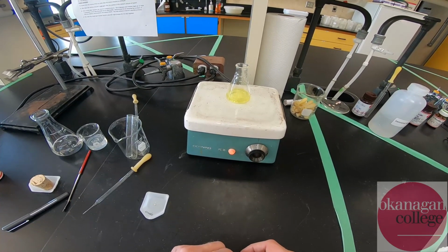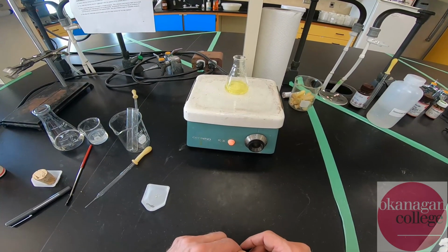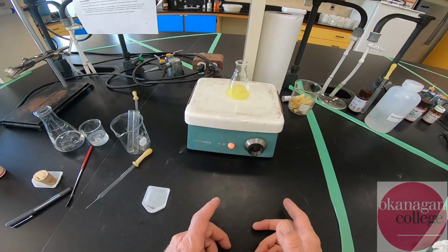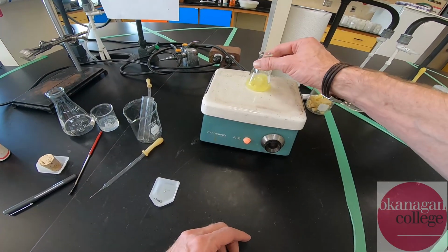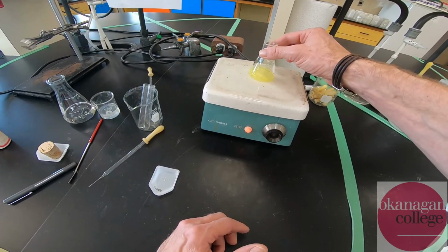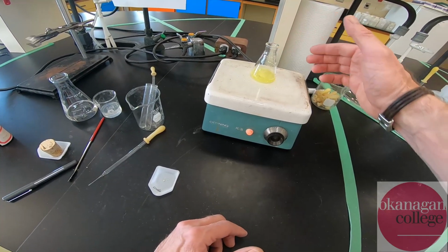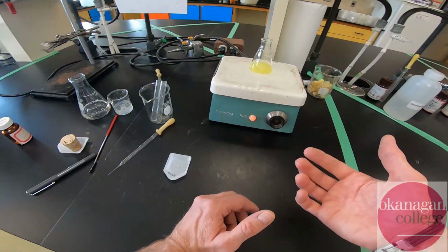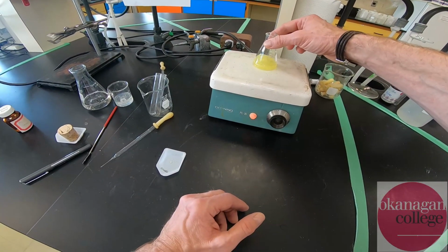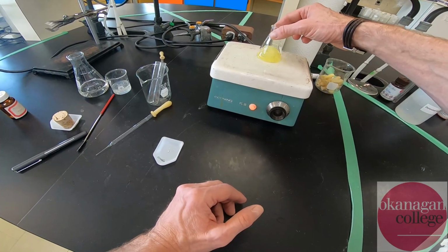Also, at some point, the conical flask won't be able to condense all of the vapor, and we're just going to lose it. So we're trying to dissolve all of our material at this point, with the understanding that perhaps we haven't added enough solvent. If we continue to boil it, the temperature's not going to get any hotter. If the solids haven't dissolved when it's boiling vigorously, we won't dissolve more material through more heating. In fact, we're going to be chasing our tail, because we'll just be losing more and more of the solvent, making it more concentrated and harder for it to dissolve the final little bit.